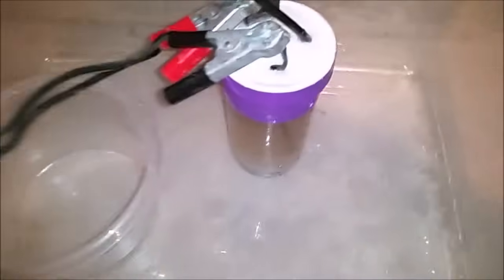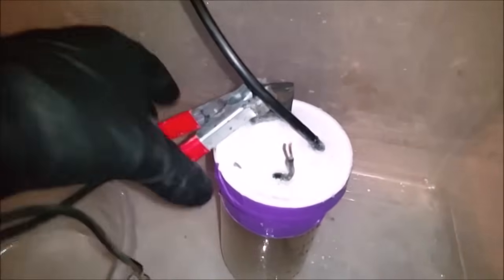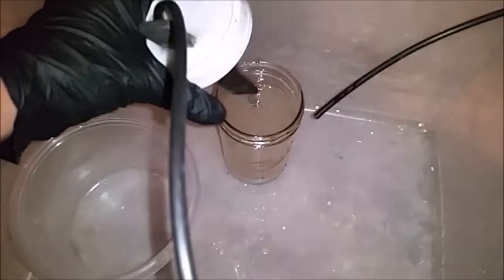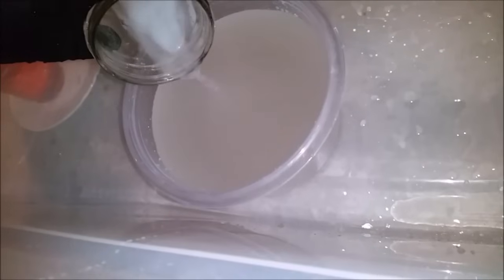Now this has been going for a little while, let's go ahead and check this out and see what it's done. I'll go ahead and unhook the electricity here. Once I get it open you can see the electrodes have fared fairly well considering the highly corrosive environment. Now I'm going to pour off the remainder of the salt water and rinse it with fresh water a few times.